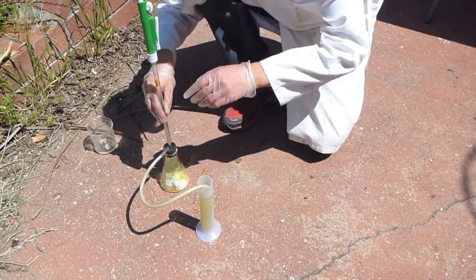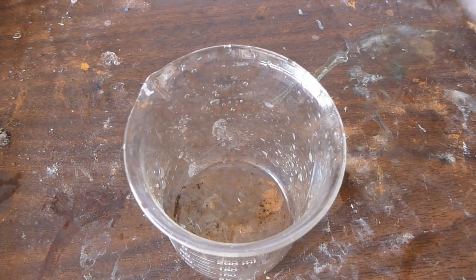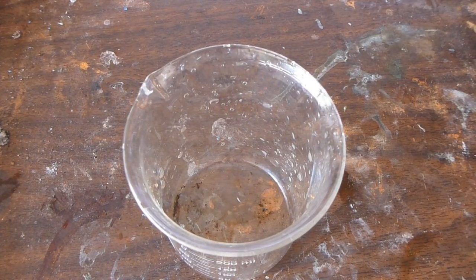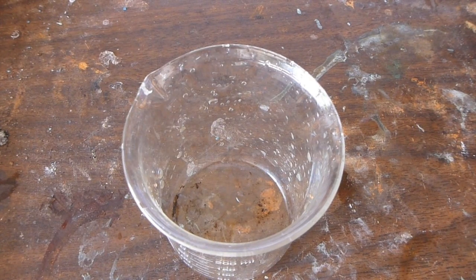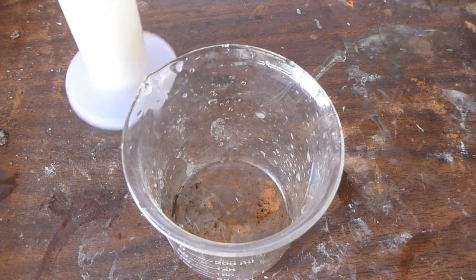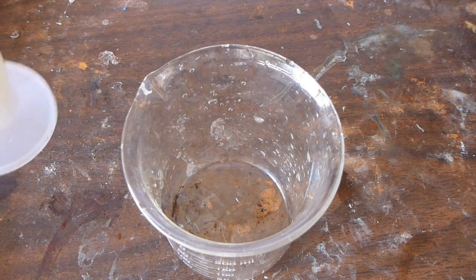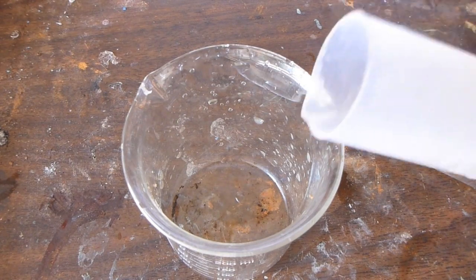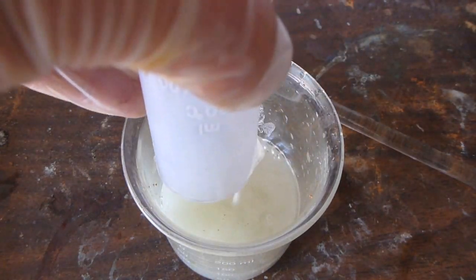Potassium periodate solubility in zero-degree water is effectively zero, so you're going to have a very high yield, and its solubility is about a thousand times less than that of potassium chloride, the other product in solution. So you should be getting pretty pure product. So I'm pouring out this slurry and just letting it settle.